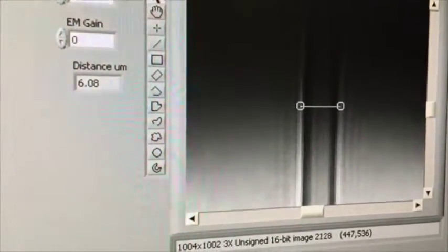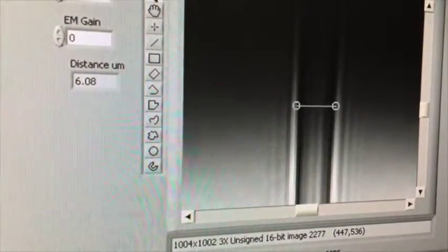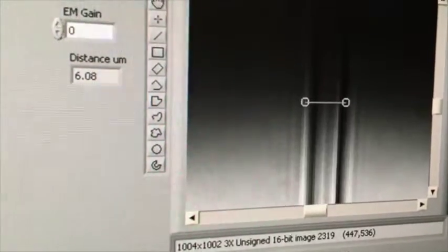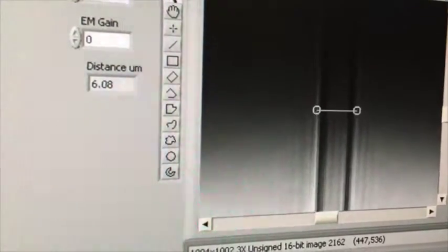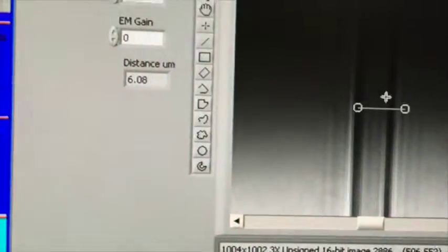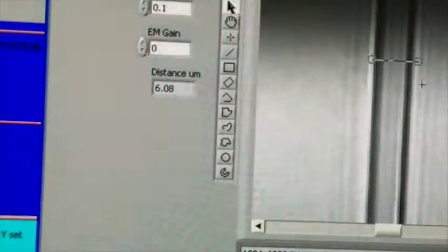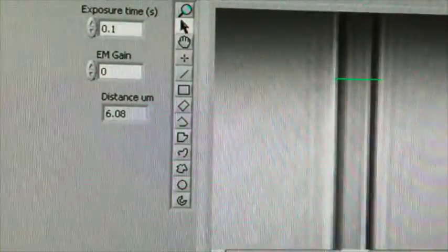I just kind of measure it by the halos. Try and get rid of all the halos. The camera only takes a picture every once in a while, like every few, let's say, milliseconds. So it's not constant. If I move my focus too fast, it's going to go right through what I want. So I'm actually moving my focus really slowly. I'm going to move my green bar into the light a little bit better. Okay. So that's pretty close.